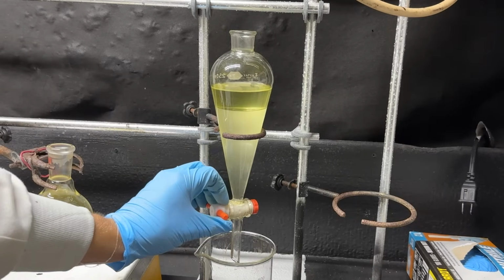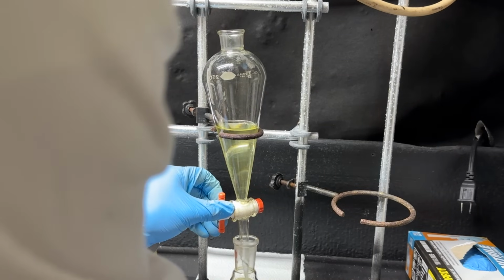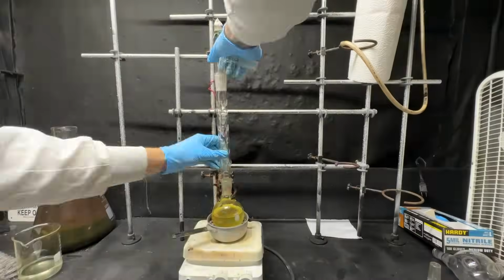Okay, it's settled out now again for our second run. Let's decant off our water. I'm going to go ahead and add the rest of it to our 250 milliliter round bottom flask. Okay, so here it is. Now we just got to do a fractional distillation.